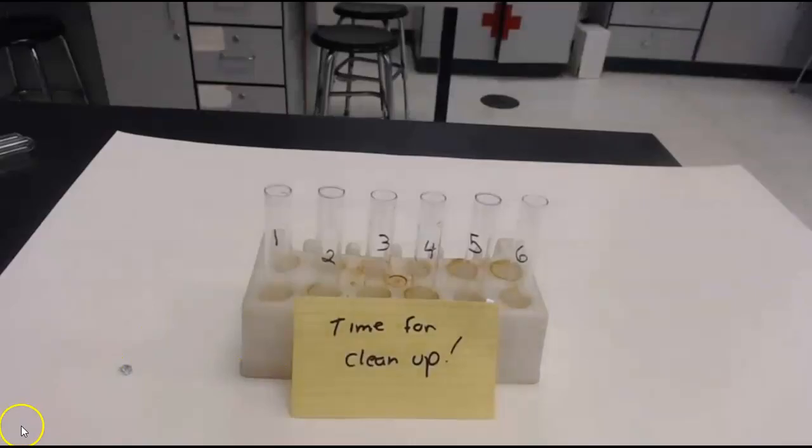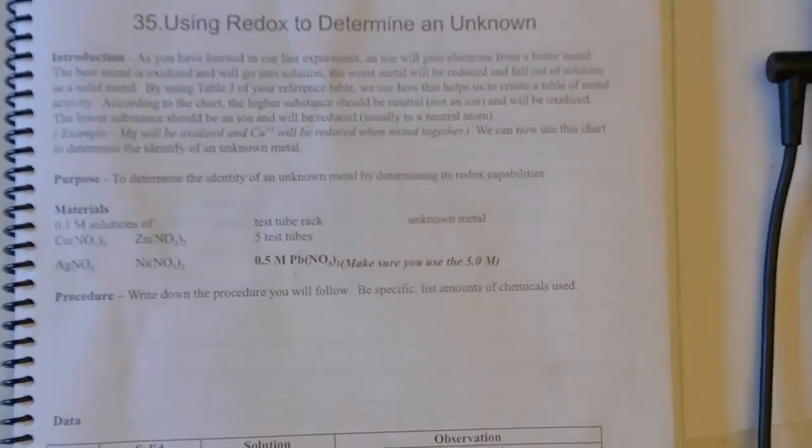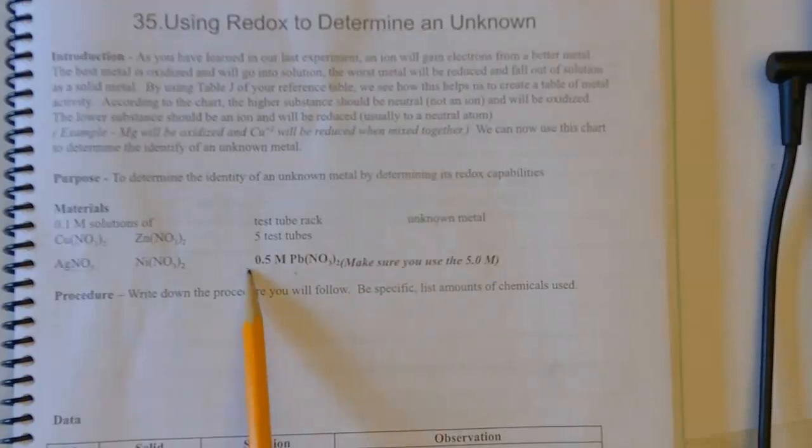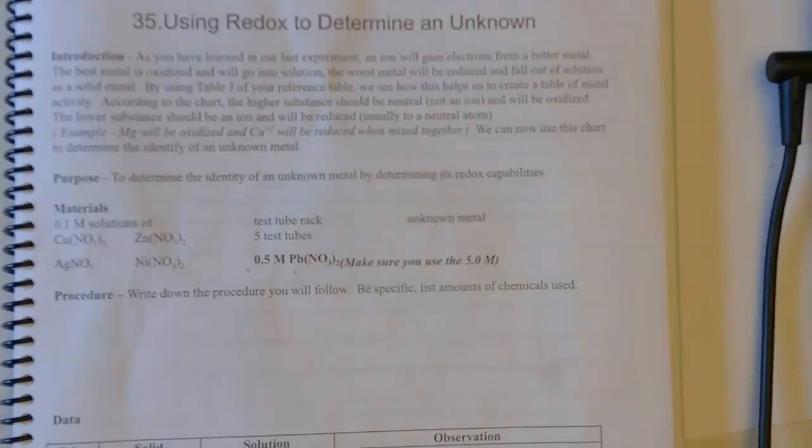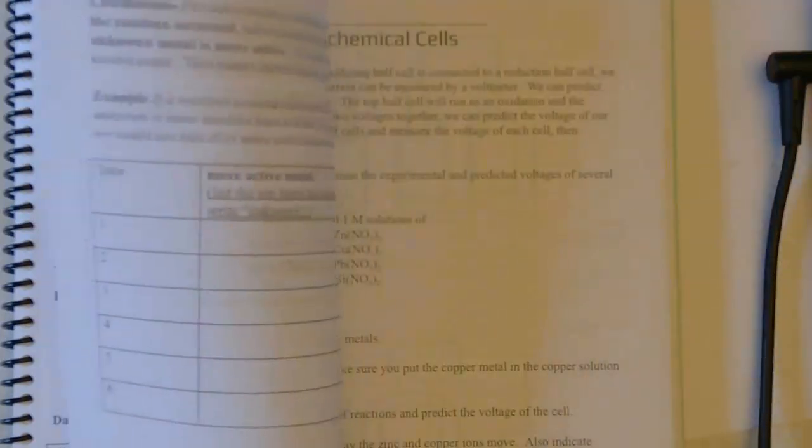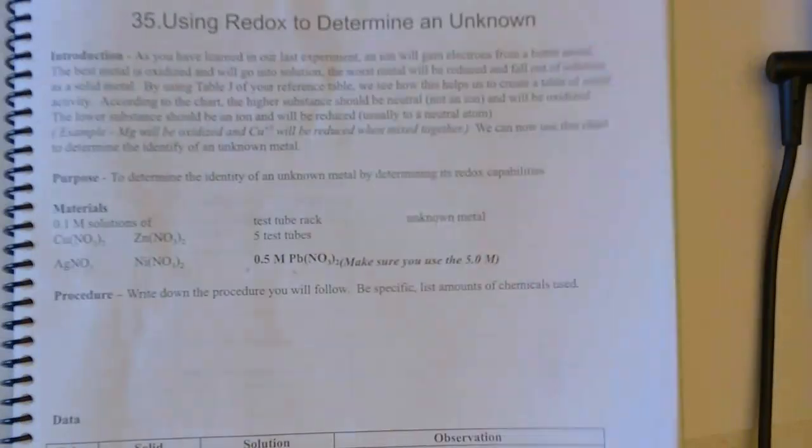Now, it's time for cleaning. So, that's it. There's our whole lab. Again, you're going to be writing down the procedure. What did you see me do? Again, the volume I used was about two milliliters of the various liquids. Don't forget, I also added magnesium nitrate in here. So, you can add magnesium nitrate. And the online sheet's going to have a space for a sixth one. And it's going to have a space for the sixth one on the back as well.